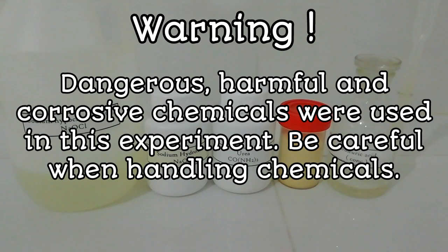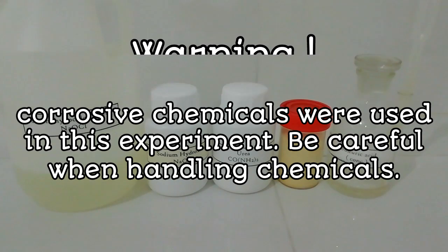Warning: dangerous, harmful, and corrosive chemicals were used in this experiment. Be careful when handling chemicals.